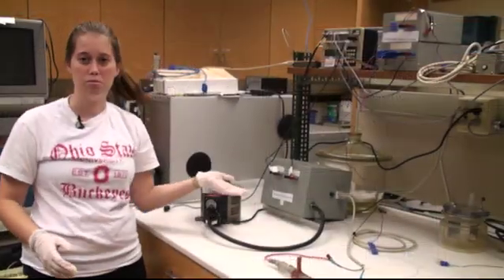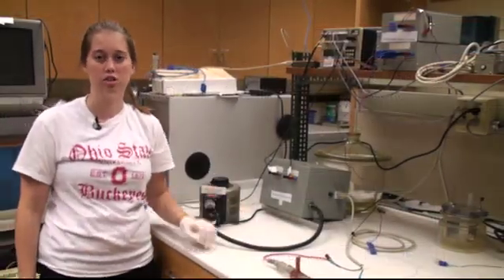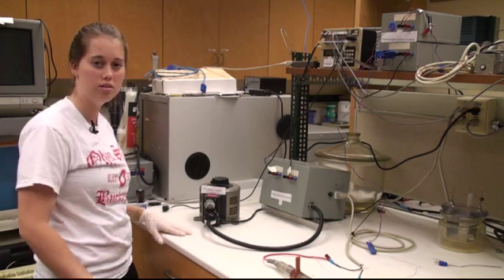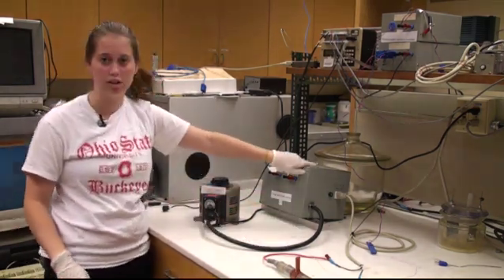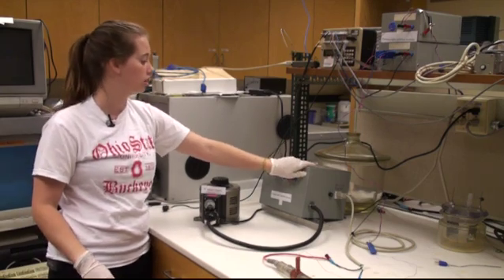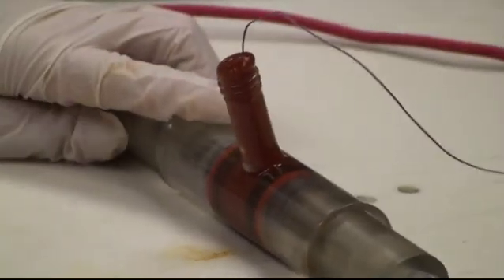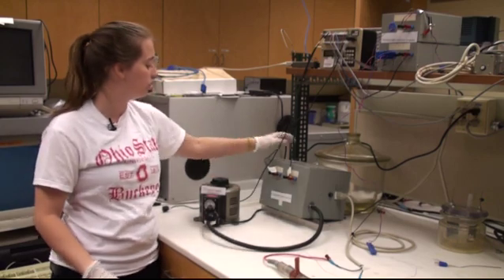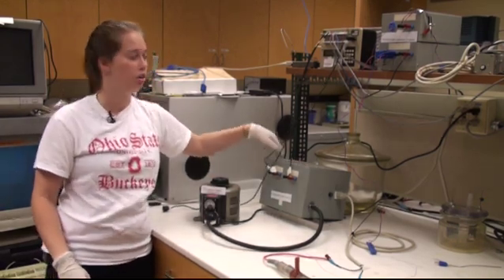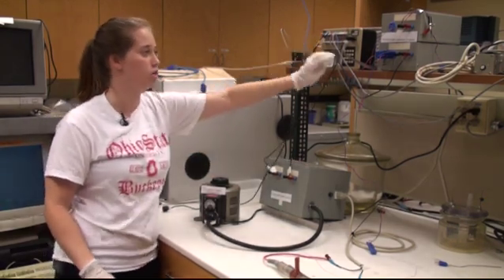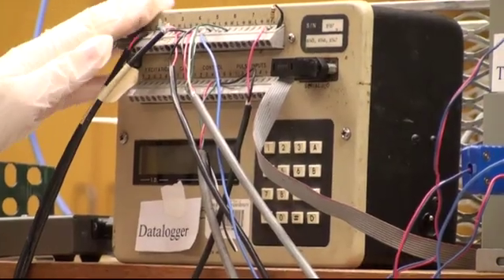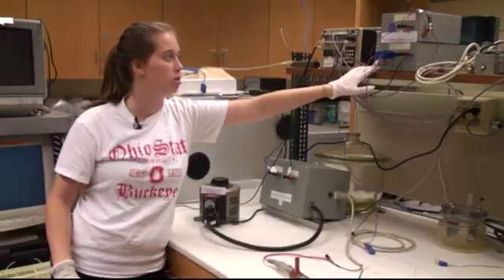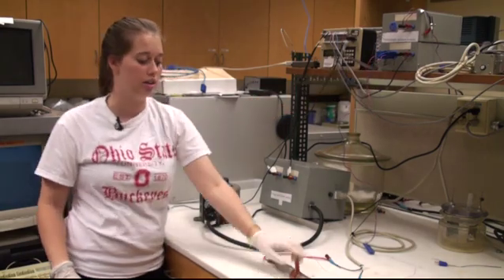This is the setup used for conductivity as a function of temperature. First the power supply is connected to the voltage and current sensor. The voltage and current sensor is connected to the T cell and also connected to the data logger. The thermocouple isolation modules are connected to the data logger. The thermocouple from the thermocouple isolation modules is connected to the T cell.